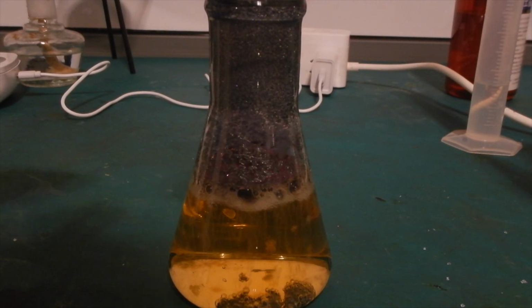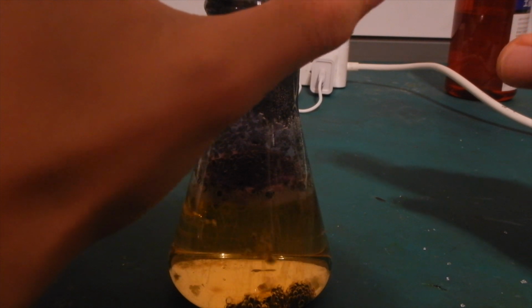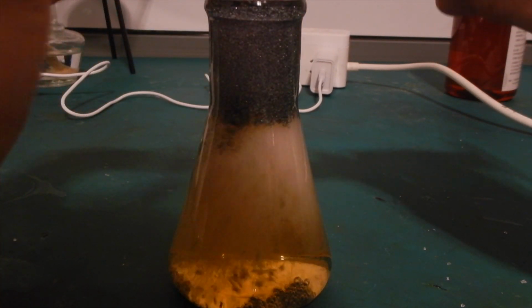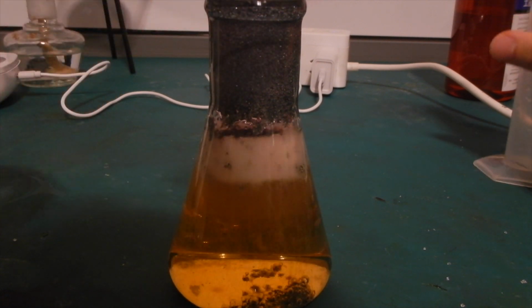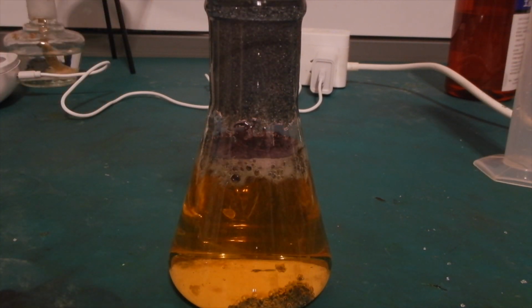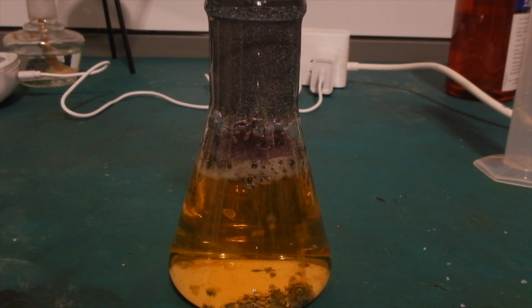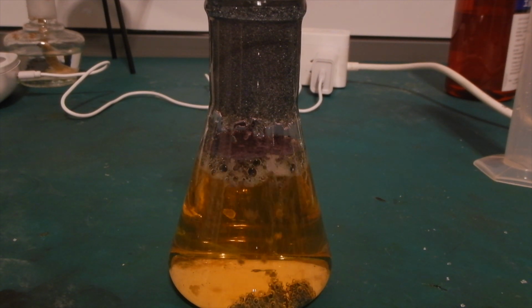When I came back, the color of the solution had turned from orange to yellow. A lot of iodine disappeared, and only a few large chunks were left behind. I added the rest of the hydrogen peroxide, and a lot of bubbling occurred. There is also quite a bit of iodine stuck on the walls of the flask.